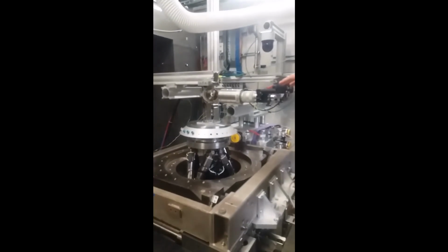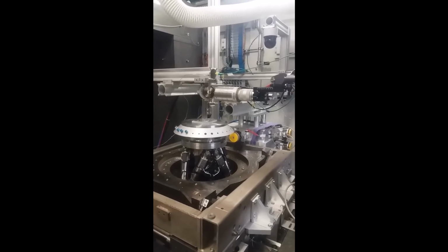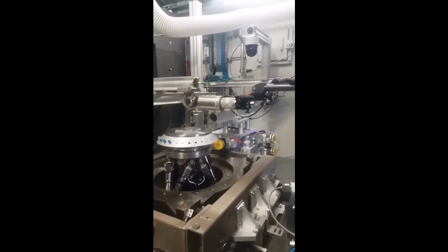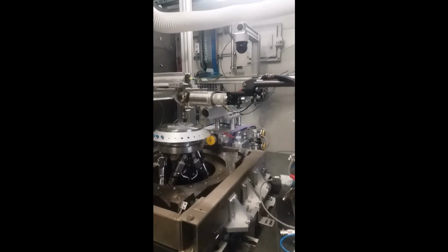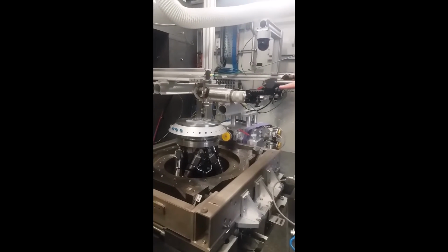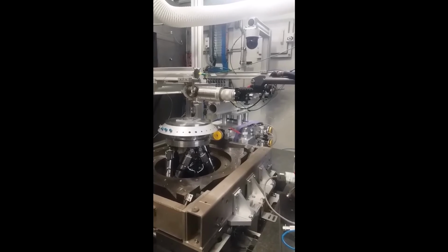And this is what we call the other station, our micro station, which has very fine movements. So we use it typically with very small beams, which our beam can go to only a few microns in size. And this setup moves conveniently within that range, right? Very reproducible. So it's a special setup.